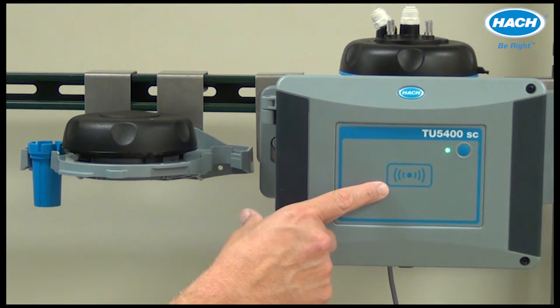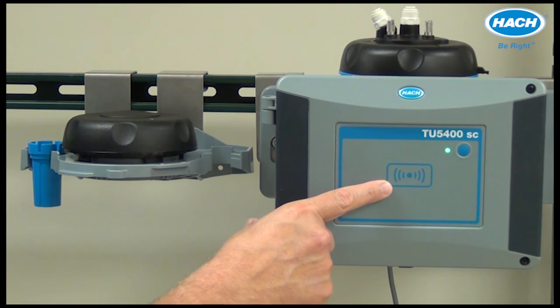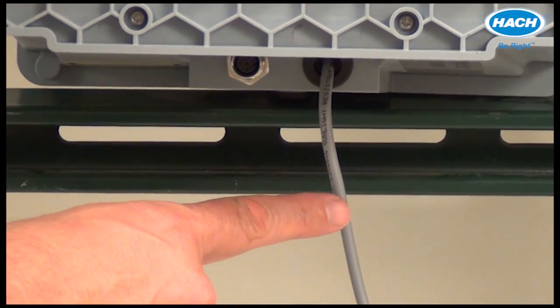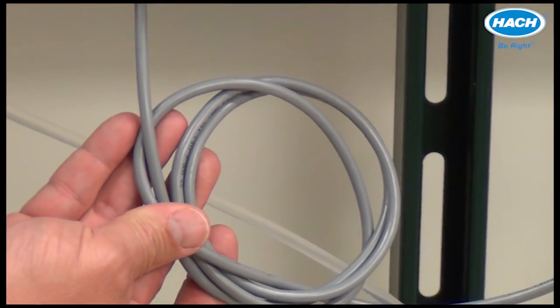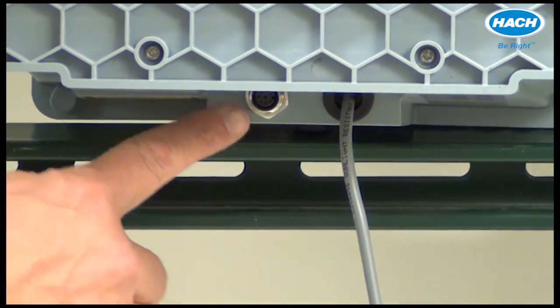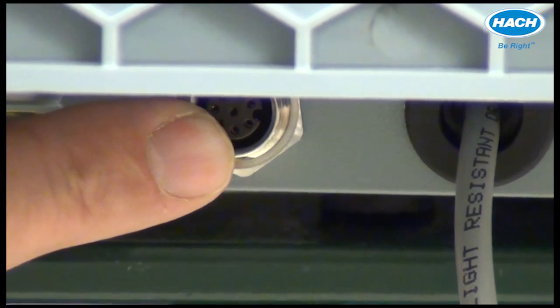The TU5300 and TU5400 may be configured with an RFID module used to receive and transmit information and data. The sensor cable provides connection to SC controllers such as the SC200 or SC1000. The maximum distance is 50 meters or 164 feet when no accessories — for example, the cleaning unit or the flow sensor — are connected. The additional port on the left provides connection to the optional accessories: the mechanical cleaning unit or the flow sensor.